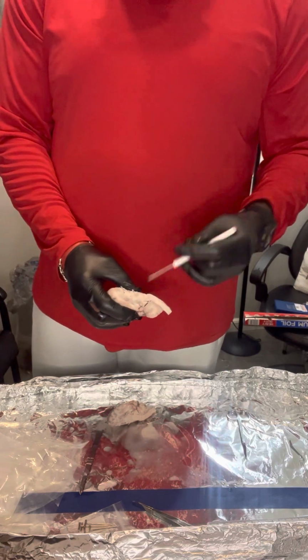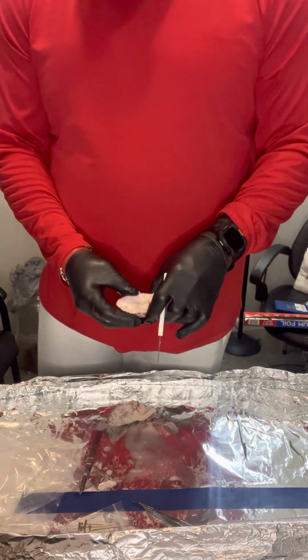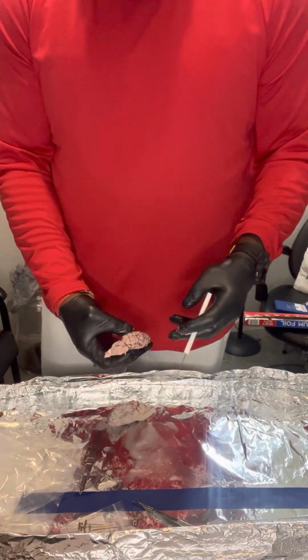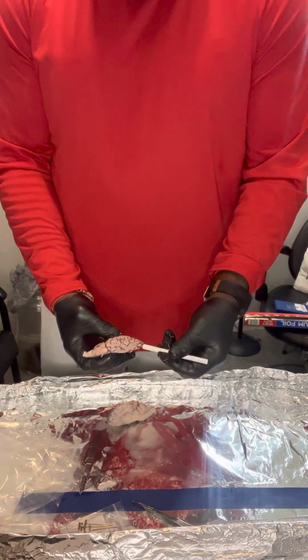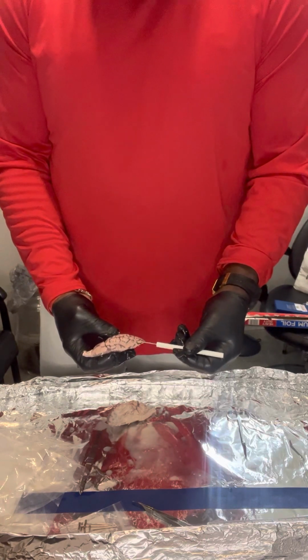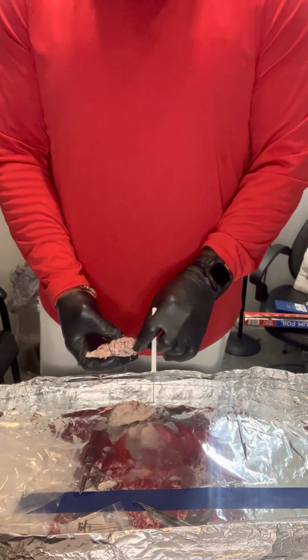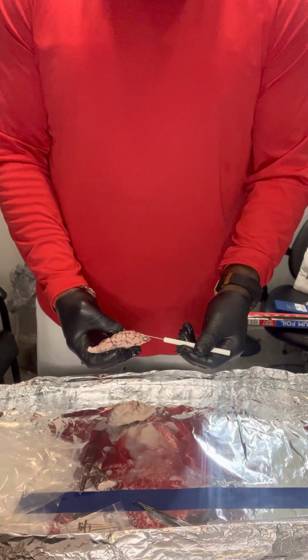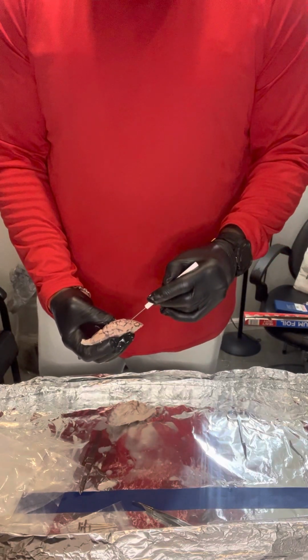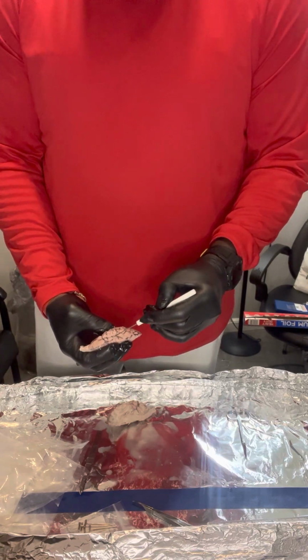Okay, the gyrus. The gyrus are bumps and ridges on the cerebral cortex, kind of the outermost layer. You can see that more on the exterior here, the outermost layer of the brain. So you see that here. And the sulcus, that's the lines, I believe. That's the cracks that we see here in the brain.